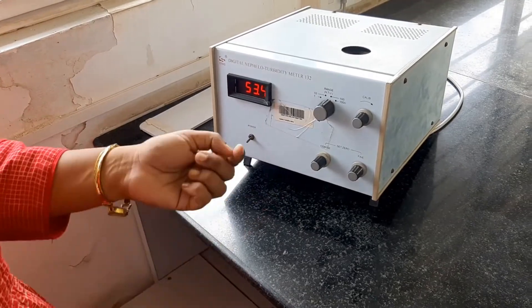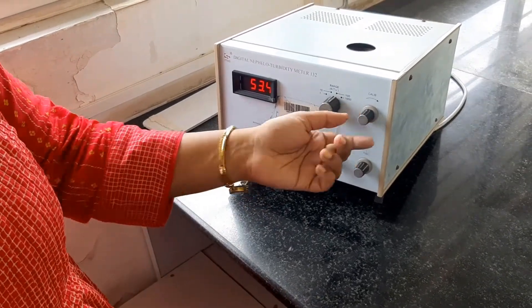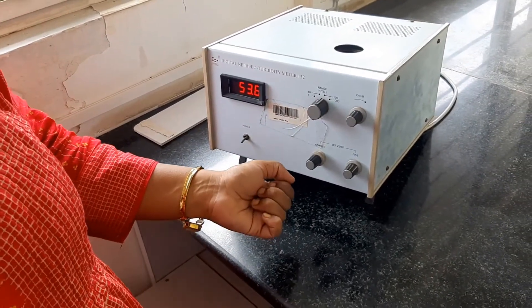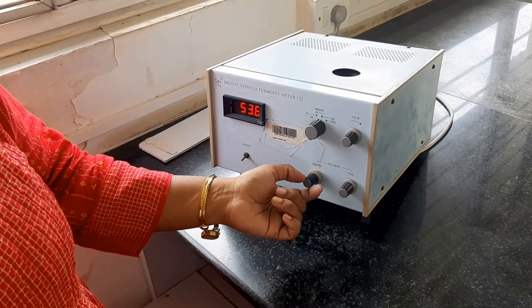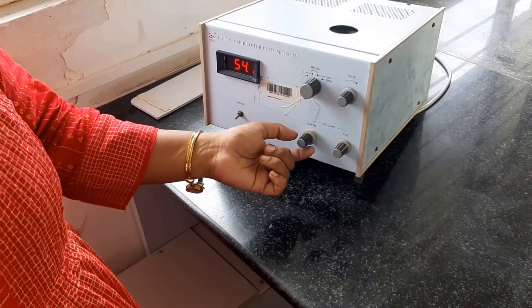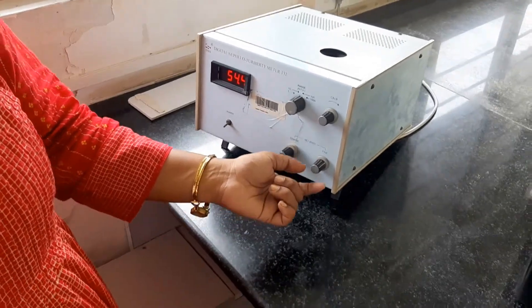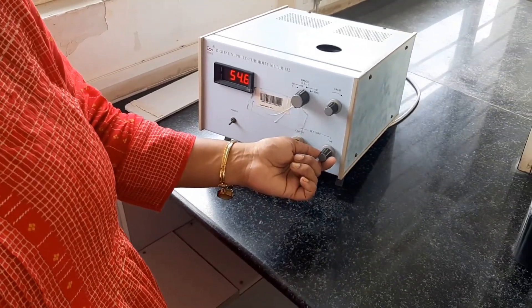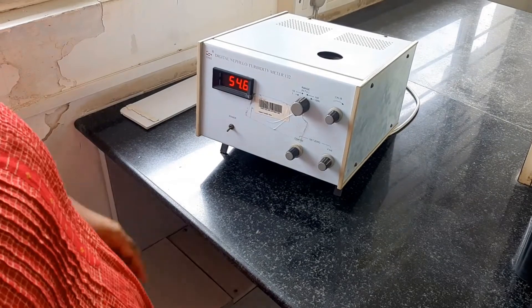For calibration we are taking 0 for distilled water and a known solution. This is a 40 NTU solution made from barium sulphate, so that is 40. We know both the values and we will be calibrating it. If I have a high value variation I will be adjusting with the coarse control, and for very fine value I will be adjusting with the fine control. So we will start the experiment.